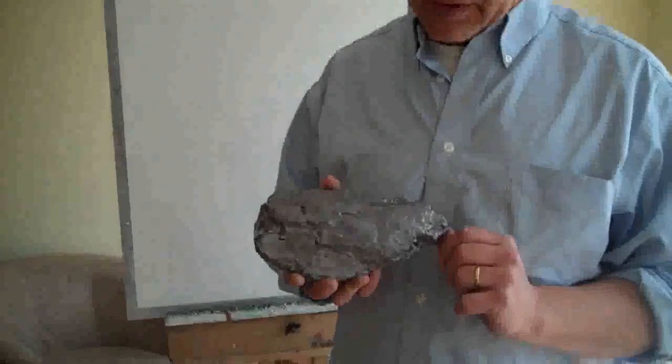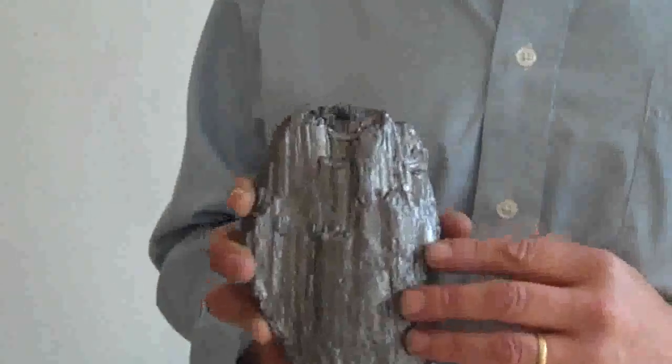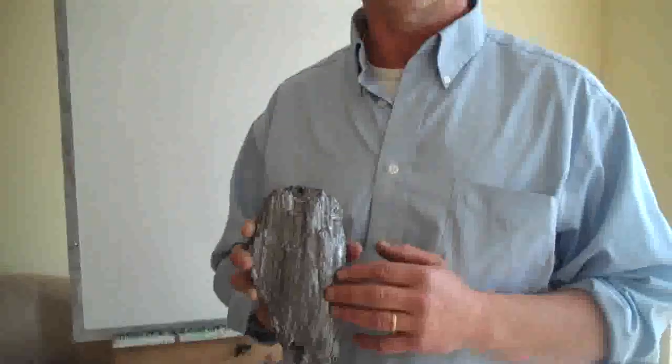The next bit is an electrochemical method. You need to saw out a piece of this to make an electrode — one and a half centimetres wide by two to two and a half centimetres high. You attach that and make sure the section you dip into the electrolyte is 1.5 by 1.5 centimetres. It's a beautiful bit of graphite, 99.9% pure, so the purity will obviously affect the results you get.